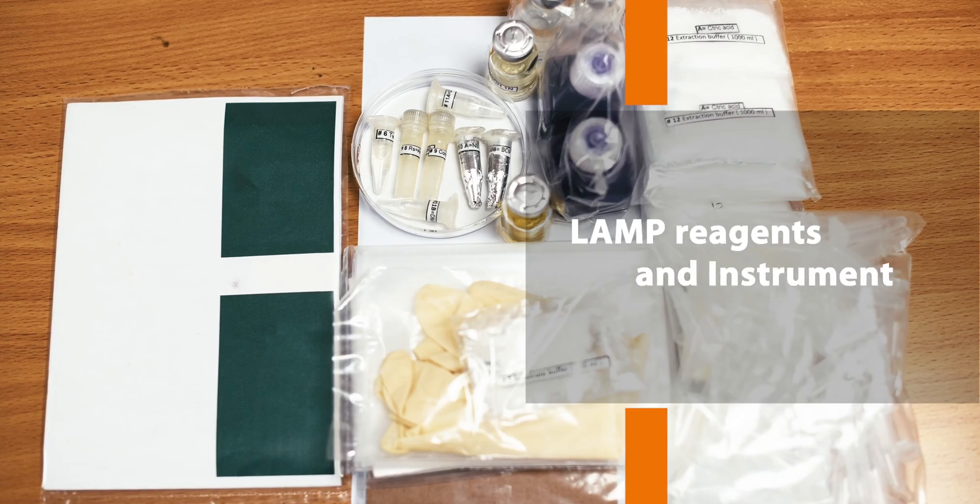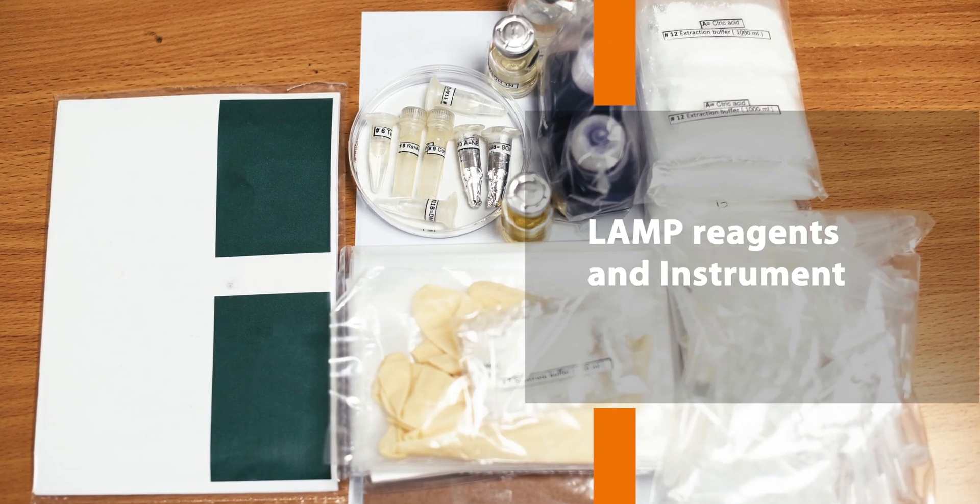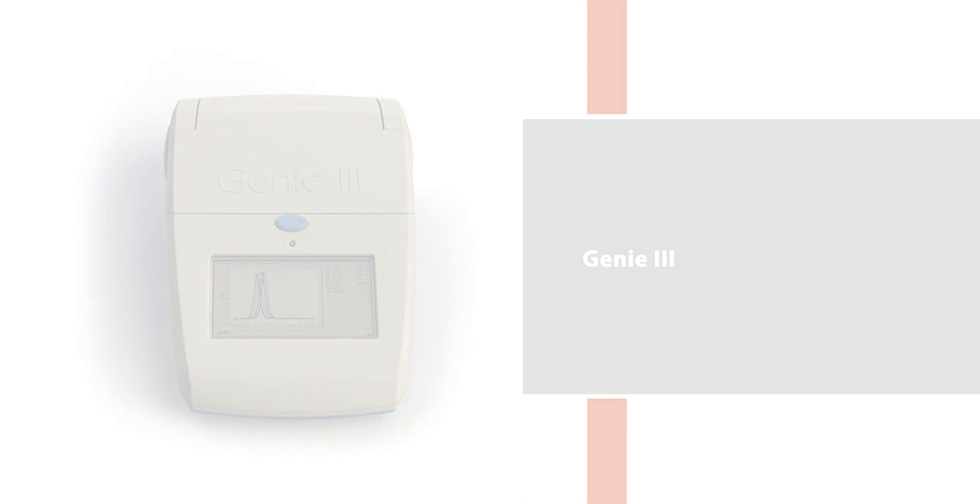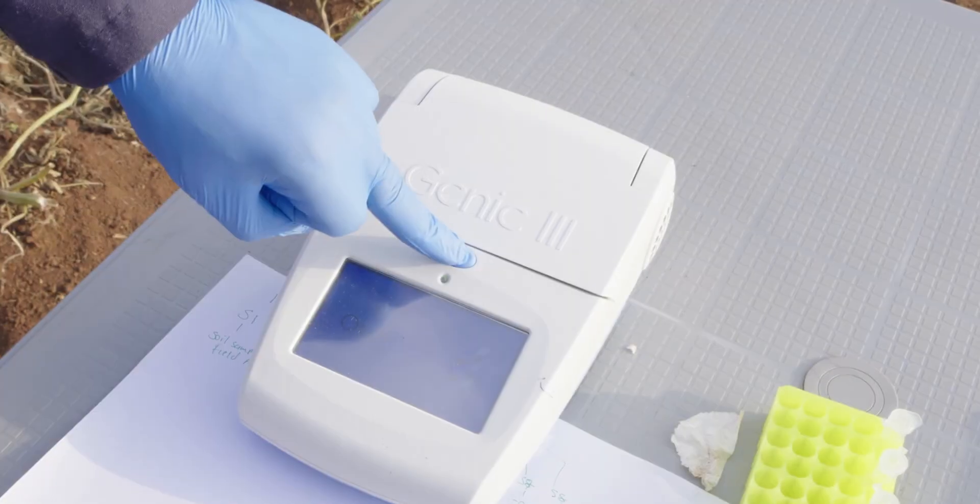Let's start with the LAMP reagents and instrument. The primary tool in your kit is the LAMP instrument. There are several LAMP instruments available. In this video, we are using the Genie3 machine.